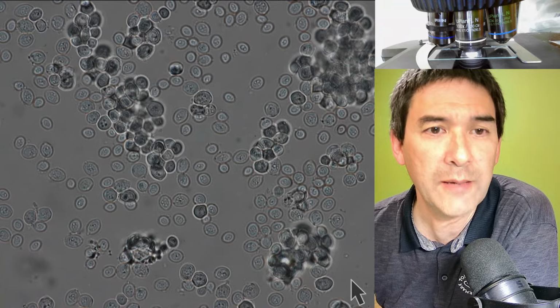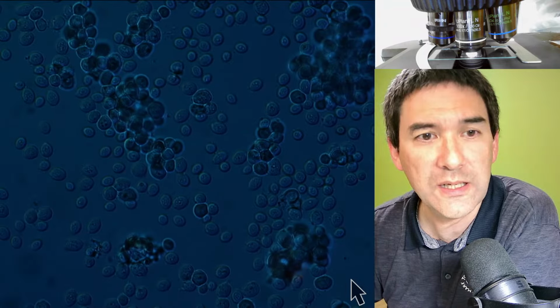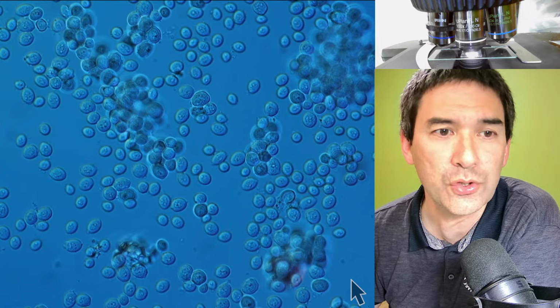Yeah, they're moving around now. You can see them vibrate. This is all due to Brownian motion. Let's just for the fun of it engage DIC again. It's kind of dark again, and this is how it looks in DIC in oil immersion.